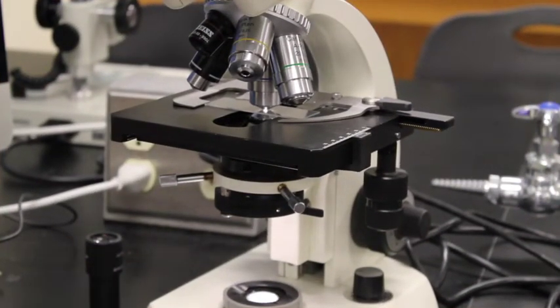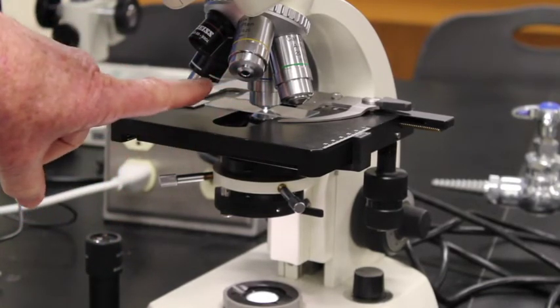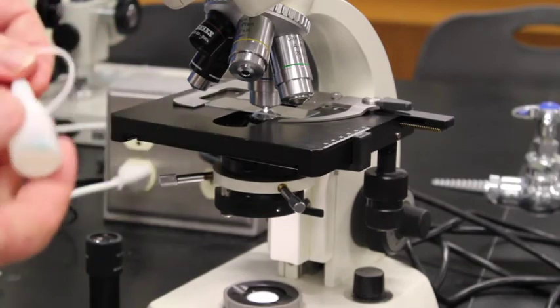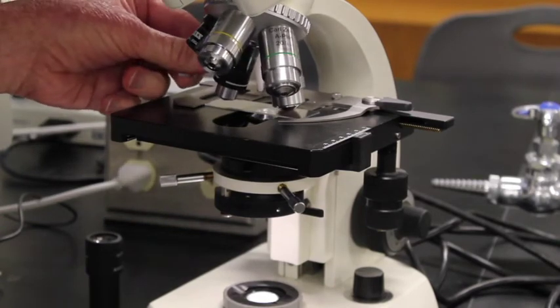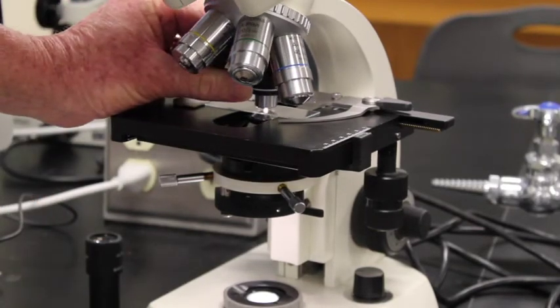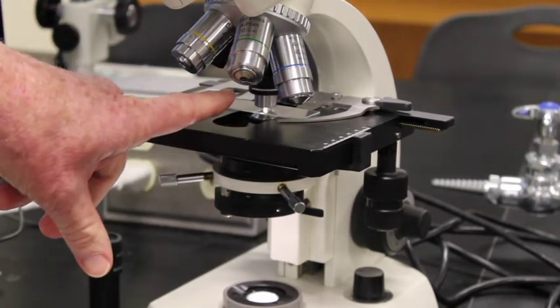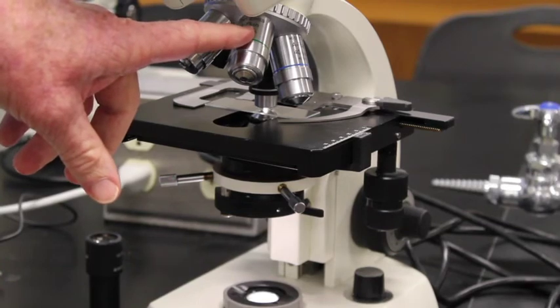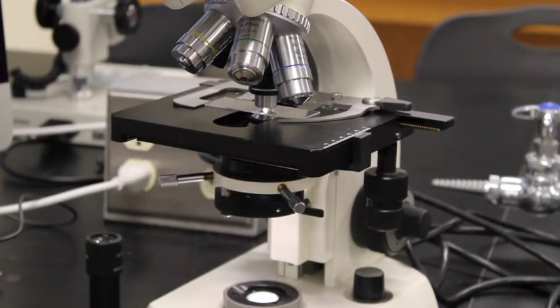To go under oil on the microscope, I'm going to swivel halfway between the 40x and the 100x, put a drop of oil directly on the microscope slide, then swivel in the 100x. Once under oil I can never go back to the 40x because it is not made for oil. Oil is designed to make more light — as you increase magnification you need more light to increase the resolution to actually be able to see a cell.